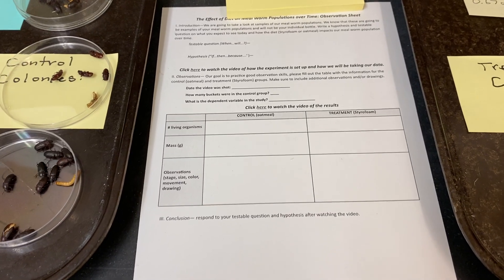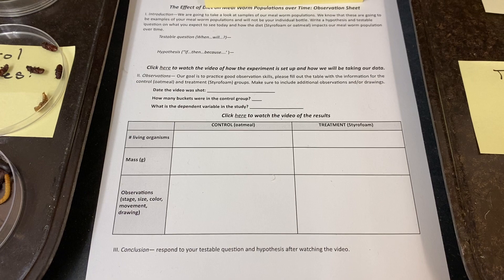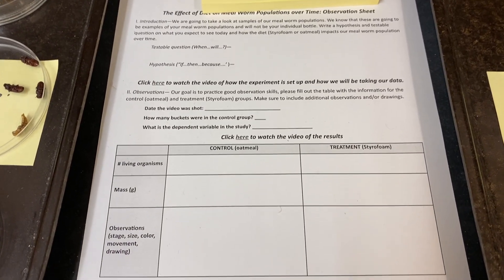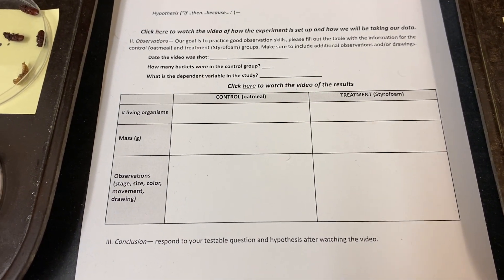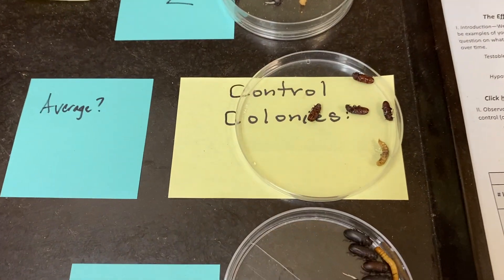All right, here we go — results time. Make sure you have your sheet out in front of you so you can write down the number of living organisms, the mass, and the observations that are going on as well. We're going to start over here on the control side.